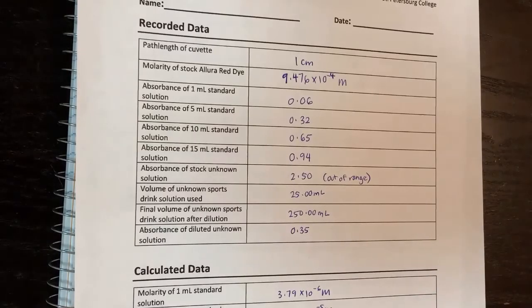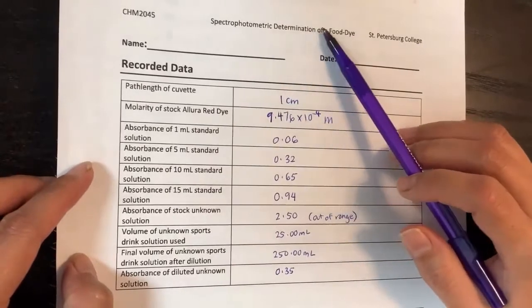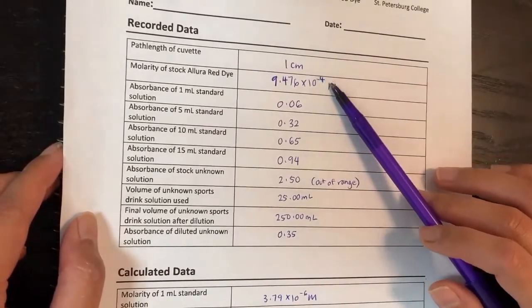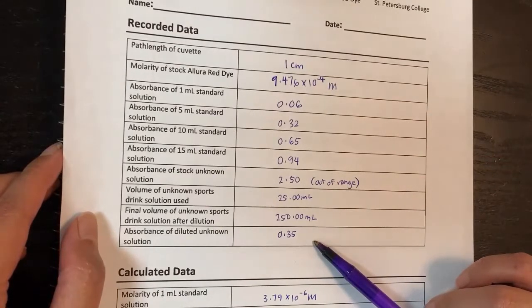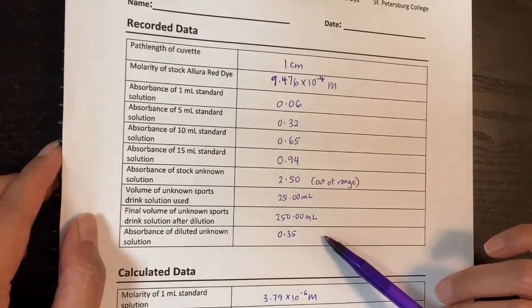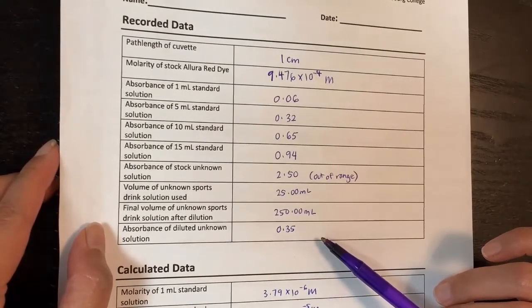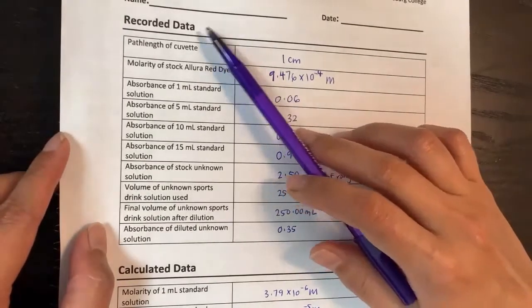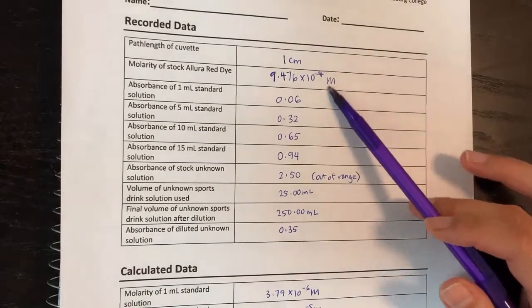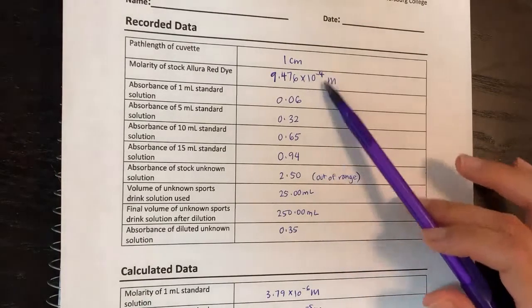We are going to learn how to calculate the data for the Gatorade experiment — the spectrophotometric determination of a food dye in a Gatorade drink. This is recorded data based on a demo video. This is not the data you will use for your lab. Your data comes from a different file, the student dry lab data Excel file, for the food dye spectrophotometry lab. I just want to show you how to calculate using a different set of numbers as a guide.